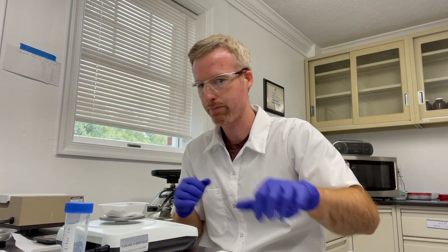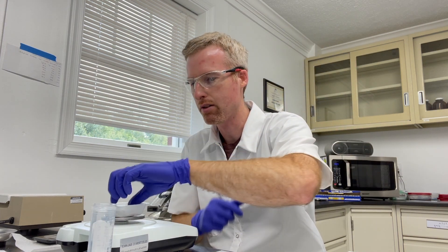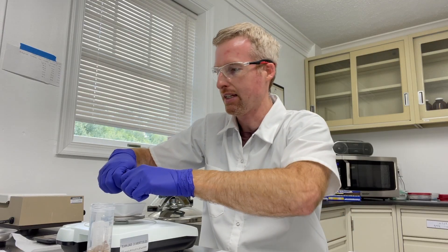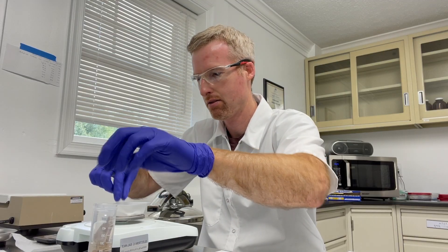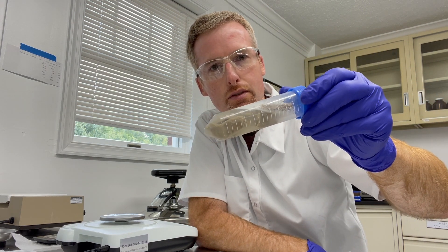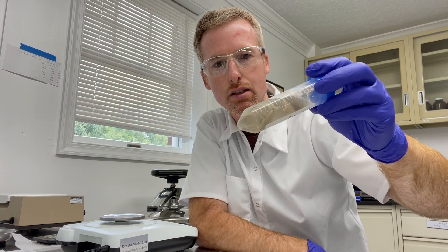7.8 grams, and then I'm going to break them into small enough pieces to go into this 50 ml tube of resuspension buffer. I have 20 mls of resuspension buffer in there and that's going to melt these E. coli cells. I'm just going to let this thaw and then I'll see you again over at the sonicator.